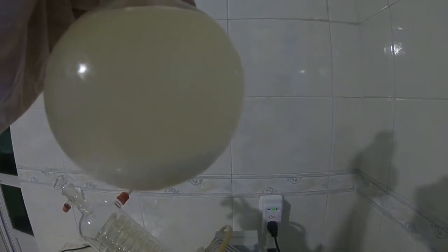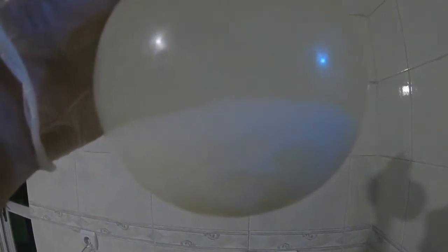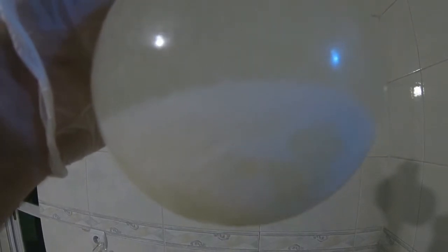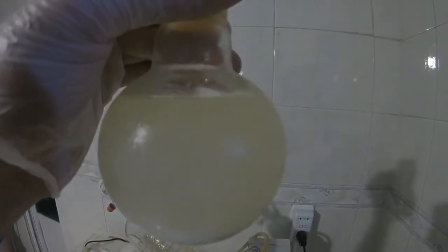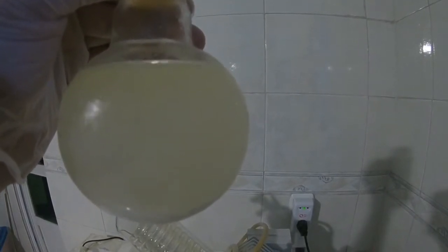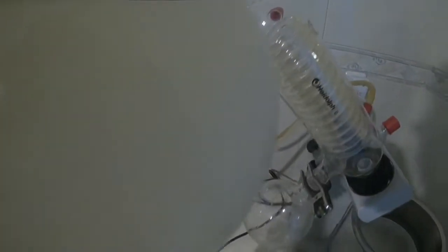It has been around 24 hours since I put the product in the refrigerator to crystallize. It has formed very nice and white crystals, even though the solution is kind of murky. I am just going ahead and filtering it. Then I will deal with the rest of the solution. I will probably run it down again under vacuum to halve the volume and let it crystallize again. But for the sake of demonstration, I think this is just enough.